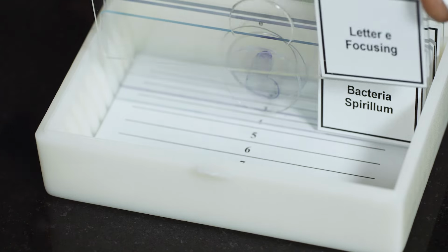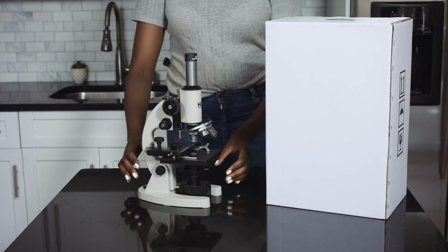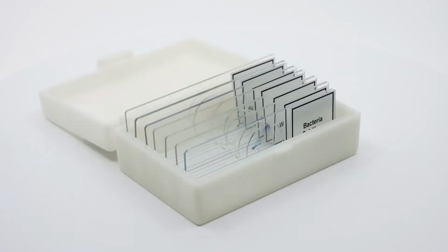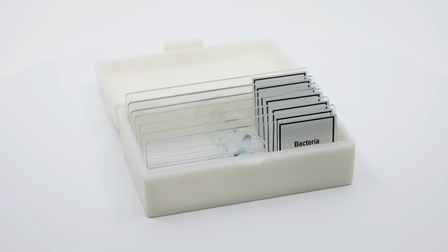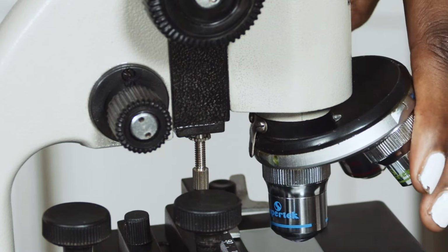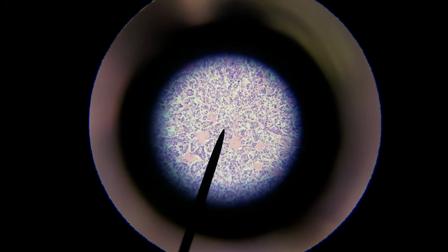We have several options for microscopy. If your school requires physical microscopes, we provide state-of-the-art compound light models along with everything students need for slide preparation and viewing. Conversely, if cost is a concern and your school doesn't have that requirement, all microscopy lessons can be completed using our proprietary vScope.